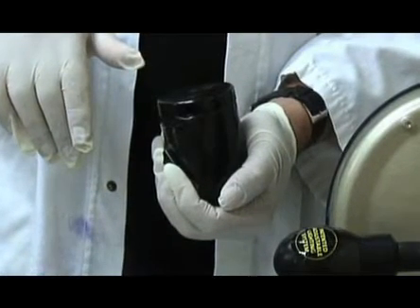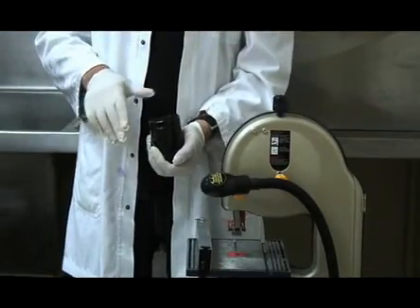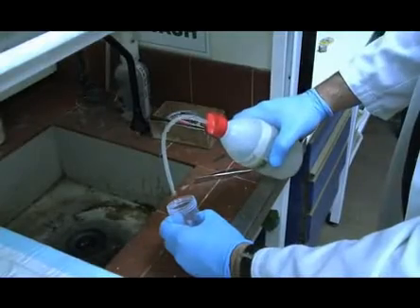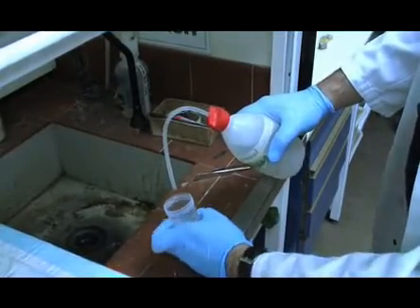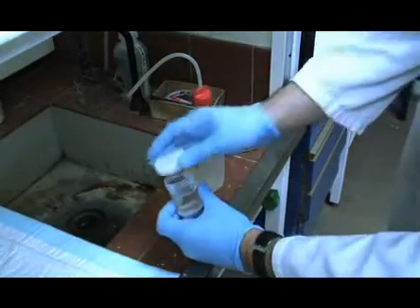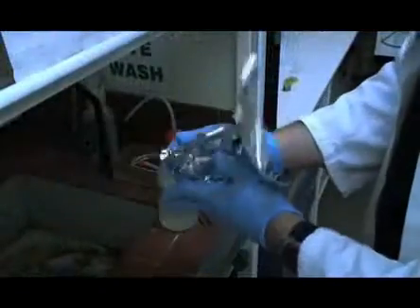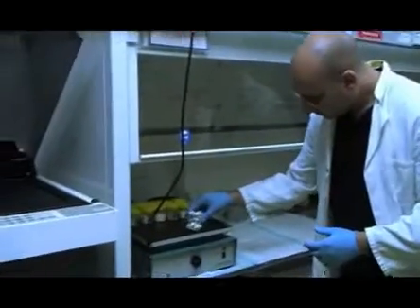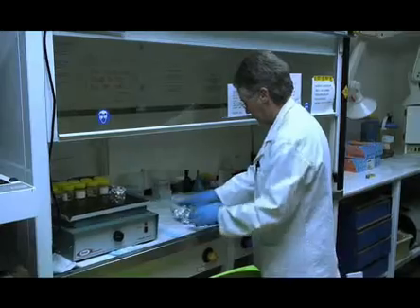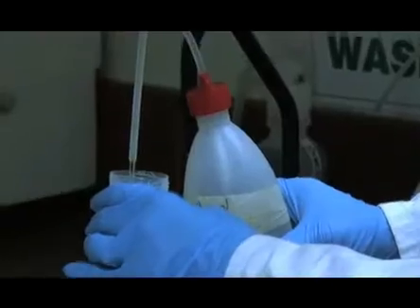The specimen should remain in the formalin solution for between one and two weeks depending on its size, after which it is transferred to 70% ethanol. Processing is then performed in a slow manner as the large size of the blocks and the low permeability of bone makes for slow diffusion of solvents. Dehydration is then carried out using ascending concentrations of ethanol and then clearing in butanol. The specimen is kept shielded from the light and under constant agitation. We recommend approximately one week in each solution. Processing therefore takes about four to six weeks and should not be rushed as it will compromise the final quality of the sections.